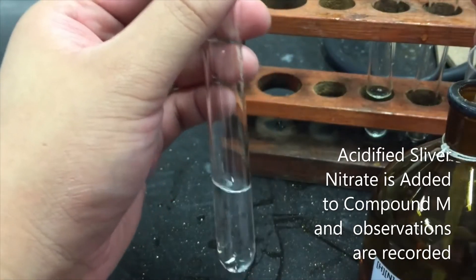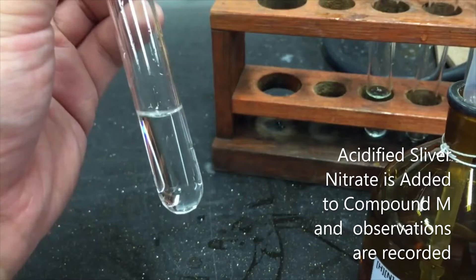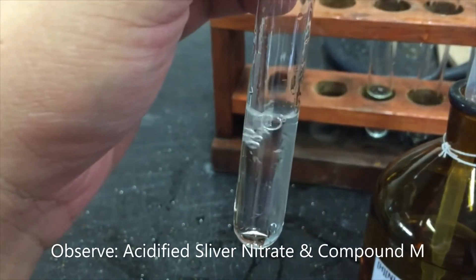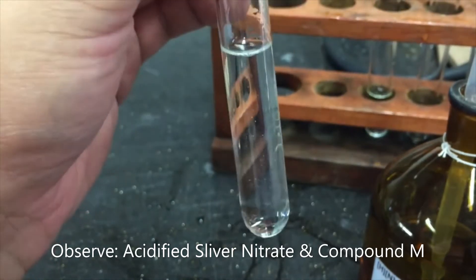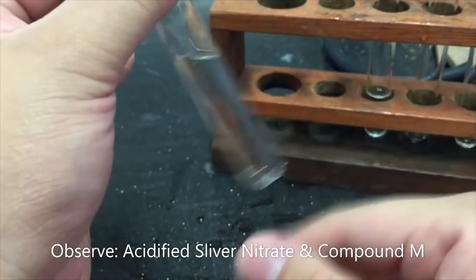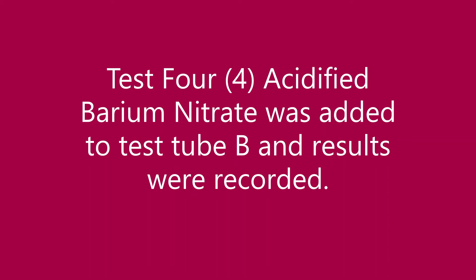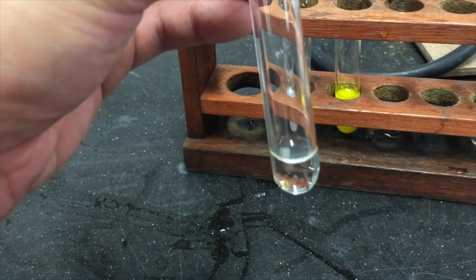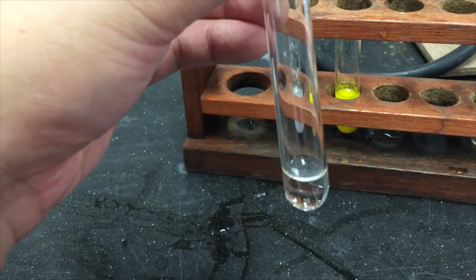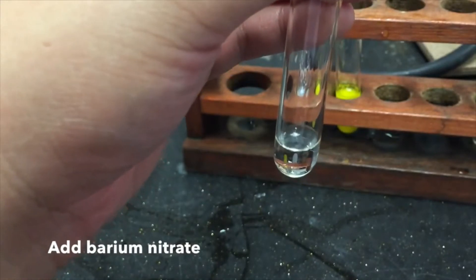To a solution of compound M, add equal amounts of acidified silver nitrate and record your observations. To a new test tube B, add a few drops of acidified barium nitrate to compound M and record your observations.